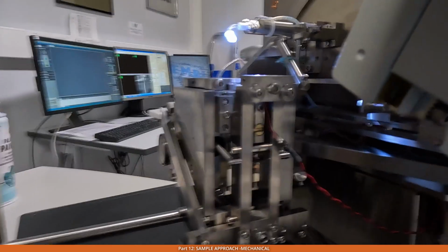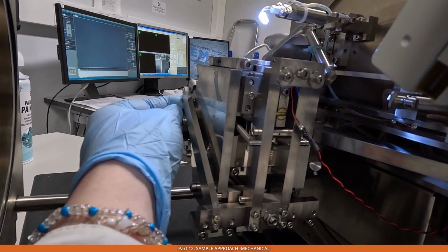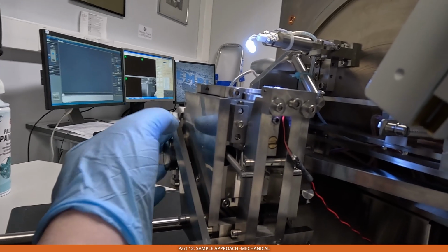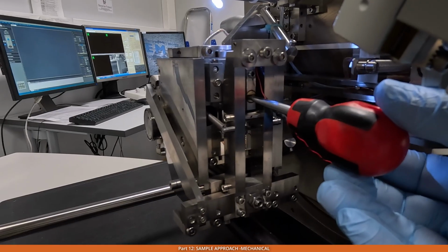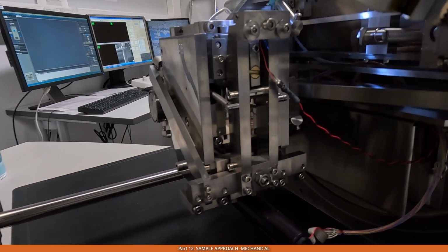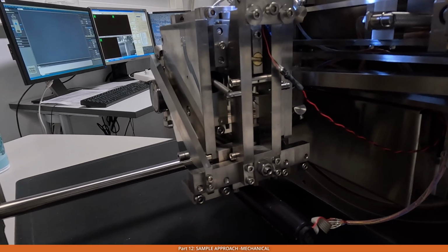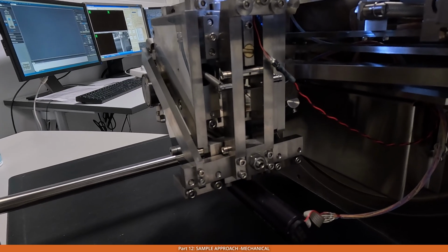The best way of doing this is you move this lever to bring the knife over the sample, and after that you start to rotate the screw to lift up the sample closer to the knife edge. This is the trickiest part, to estimate the actual distance between the knife edge and the top of the block face, because the top of the block face may be slightly tilted and things like that.